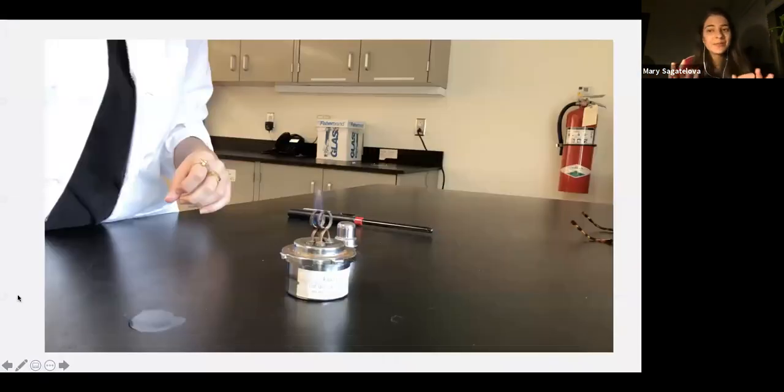And this is just going to be a little bit of a refresher on how to get microcentrifuge tubes out of the container, because it is a sterile container, and we saw some not so aseptic technique last time we did serial dilution. So this is just to clear it up.